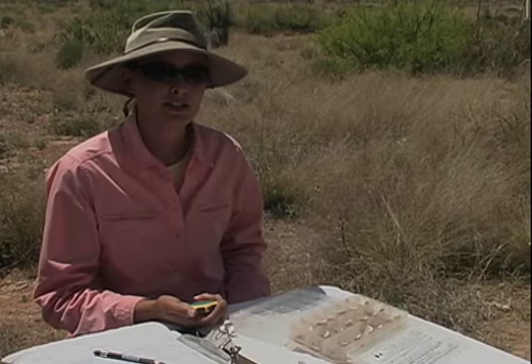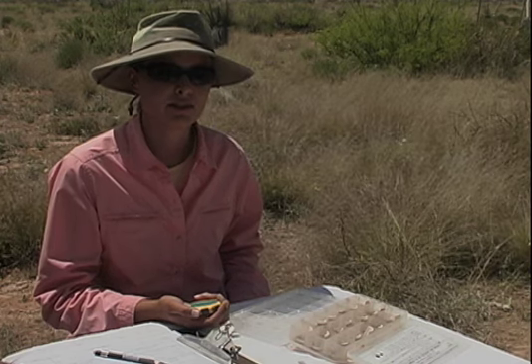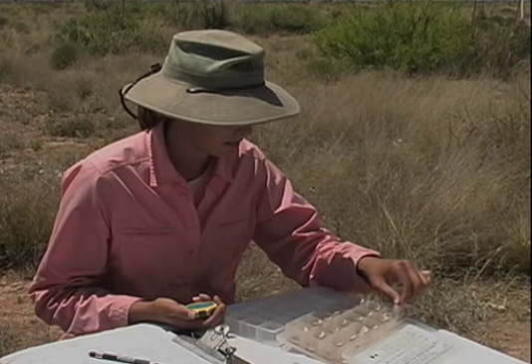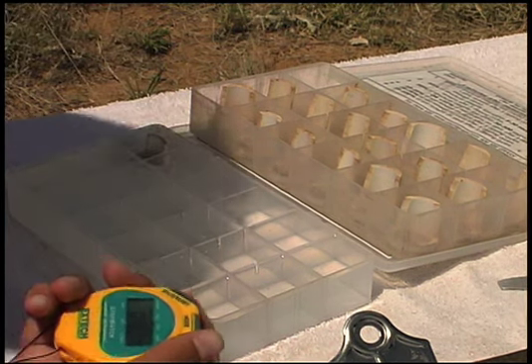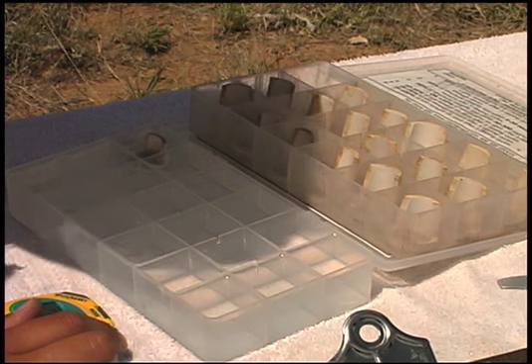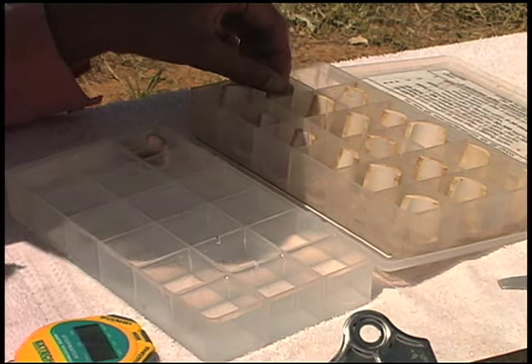I'm now going to run through a whole box of samples, which means I'm going to be putting 1 sample in every 15 seconds. Start the stopwatch when the first sample touches the water. From the time the sieve screen touches the water surface to the time it rests on the bottom of the box, 1 second should have elapsed.